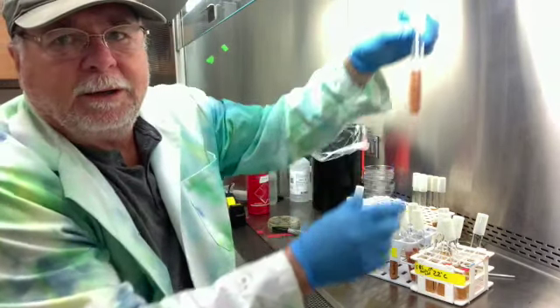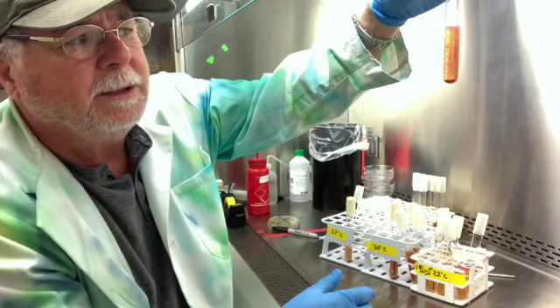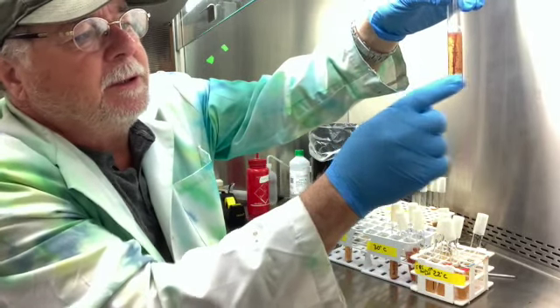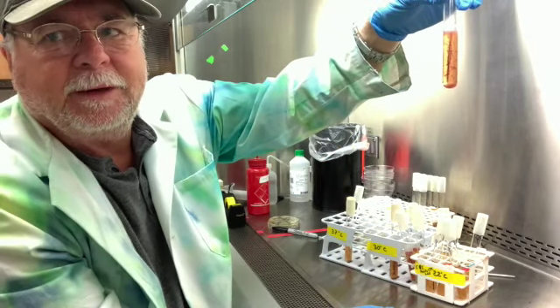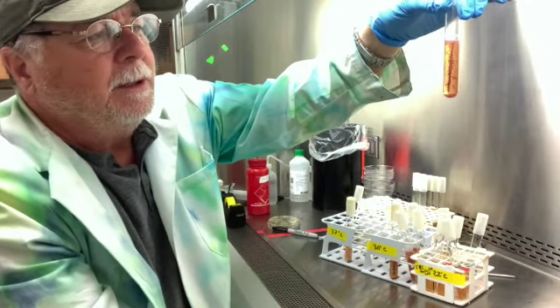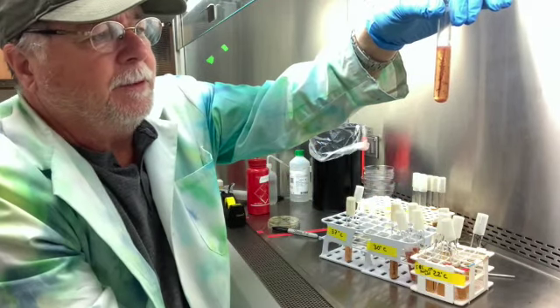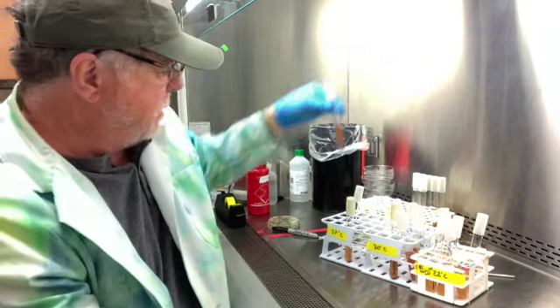The first one here is E. coli. E. coli is growing throughout. It's out into the area because it's red. It interacted with the TTC material. It's growing better at the surface, but it grows throughout equally, fairly well. And so this is a facultative anaerobe, and it is motile. So E. coli, number one.